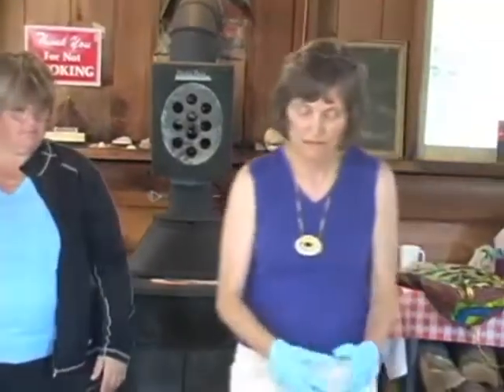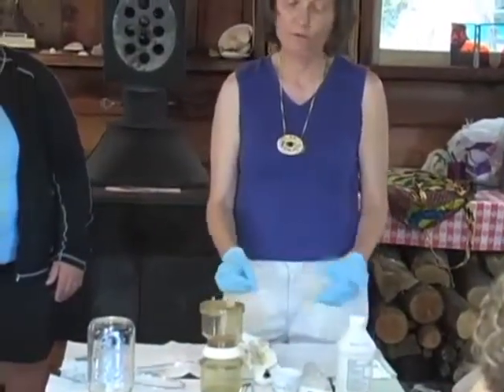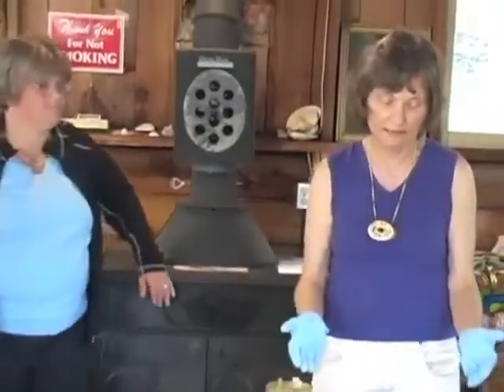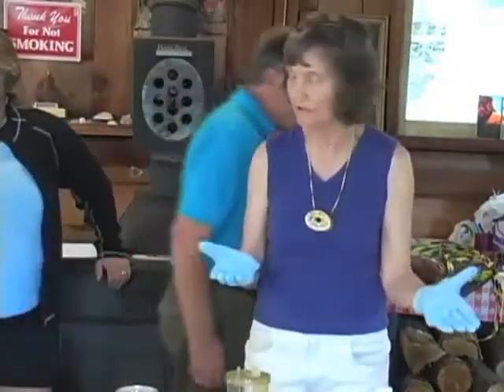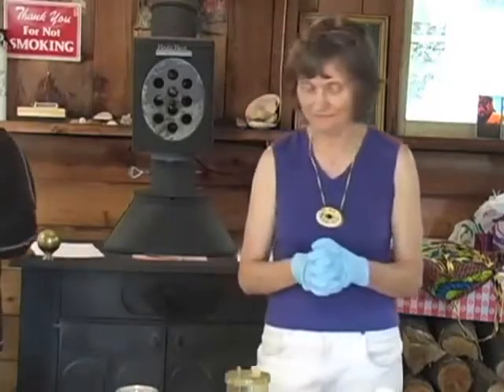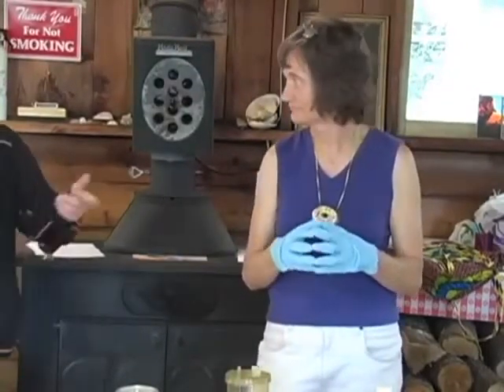So I have some rubbing alcohol in here to keep my tools sterile in between. Now one way we can test whether we're using sterile technique is to do a blank. So we'll run one using distilled water. That water has been distilled, so there's no bacteria in it. It's been boiled and recondensed, so we know there's no bugs or pathogens that live through that process. So assuming the bottle was handled appropriately and sterile, we shouldn't get anything from it.